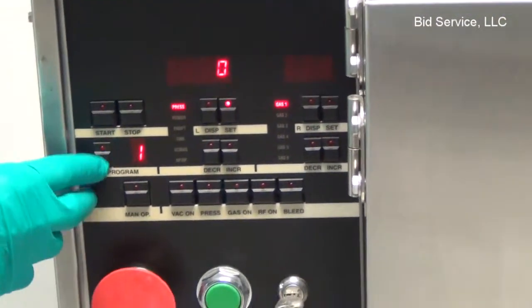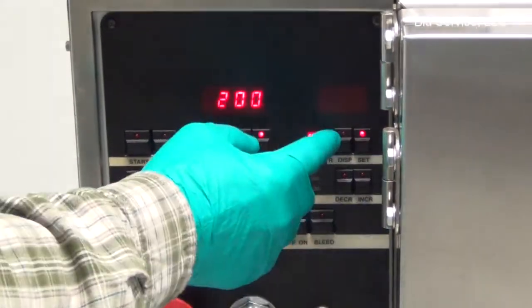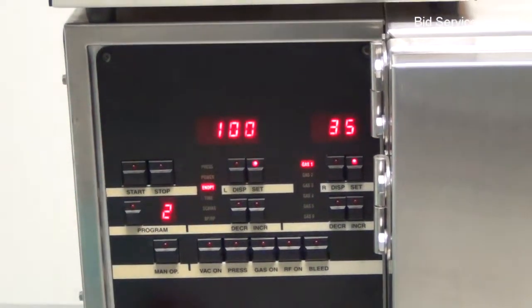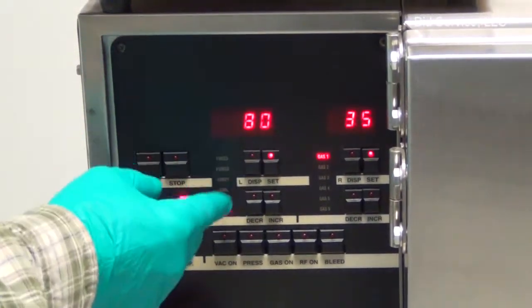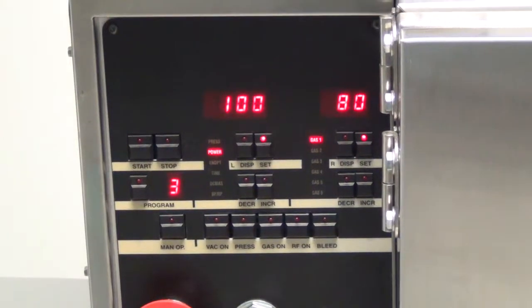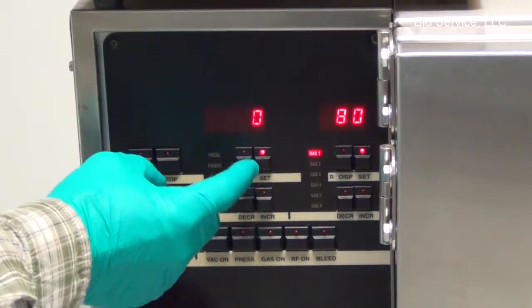Now, what I did is I wrote 4 programs that are going to run. For program 2, the difference is the power is going to be 200 and the gas pressure is 30. The gas flow will be set at 35. Again, endpoint 100, time will be 60 seconds, and the base pressure 80. For 3, change the power to 100 and the flow to 80. Channel 1, so that's argon for those 3 programs, with different power levels. Endpoint 100, time 60 seconds again, and base pressure is 80.